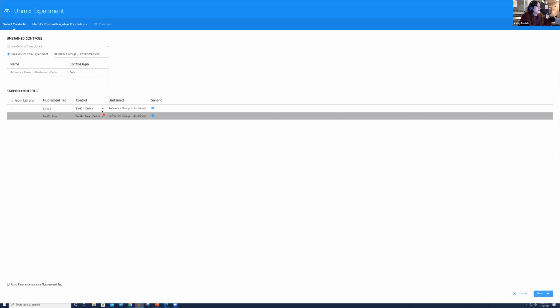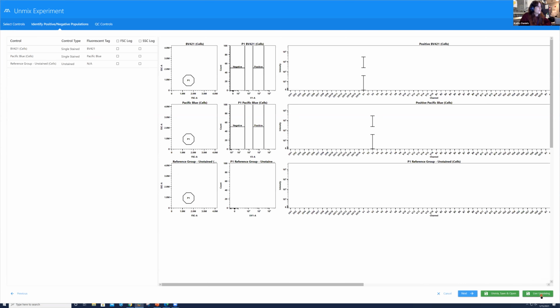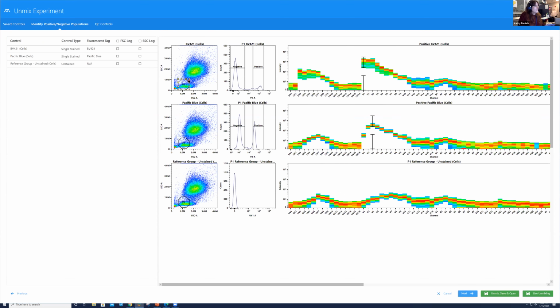And here we see we have BV421 and PAC blue, okay? I know that some people might have questions on the autofluorescence. That will be coming shortly. So we're going to go ahead and hit next, but we're not going to focus on the autofluorescence right now. Here, remember from last time, what we can do, if I click on control on our keyboard and I make changes to our scatter plot, our P1, it's going to change for all the cellular controls here, okay? So as I make that change, it's going to apply to all.